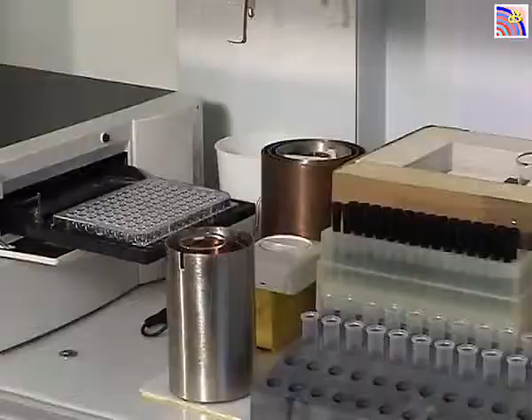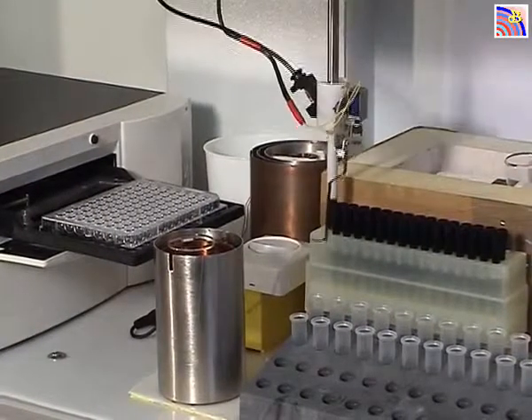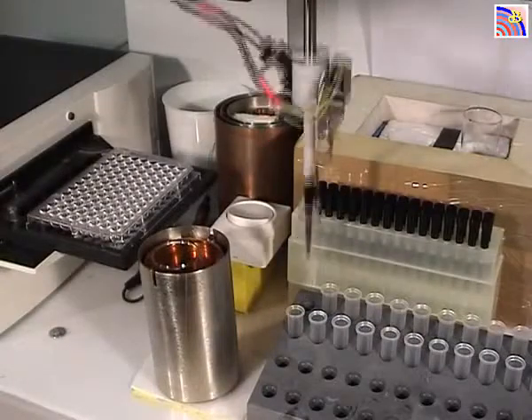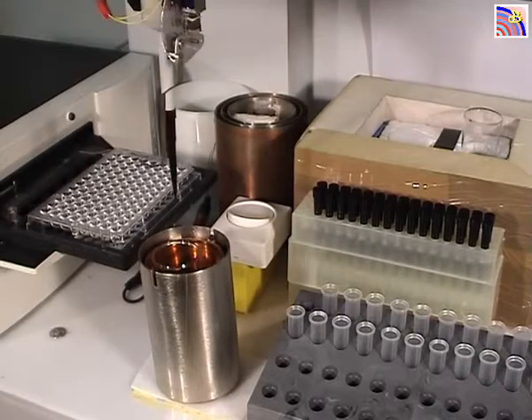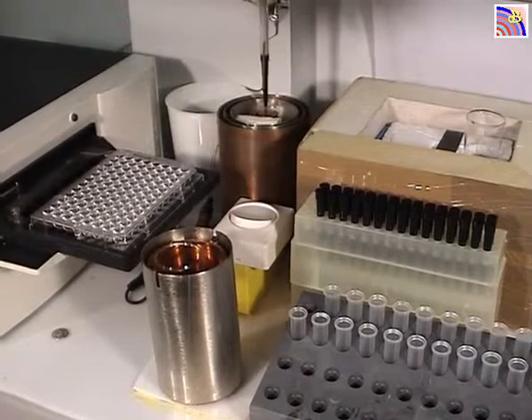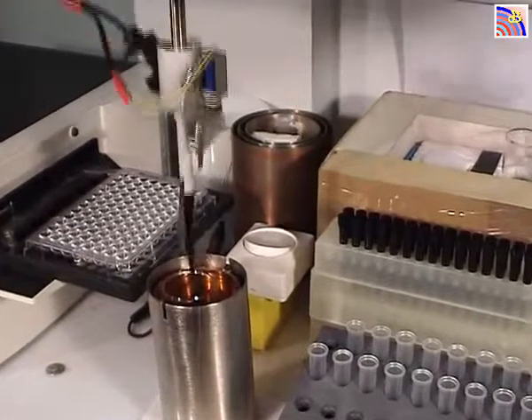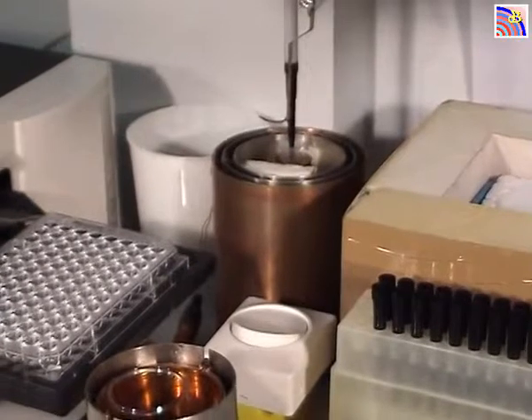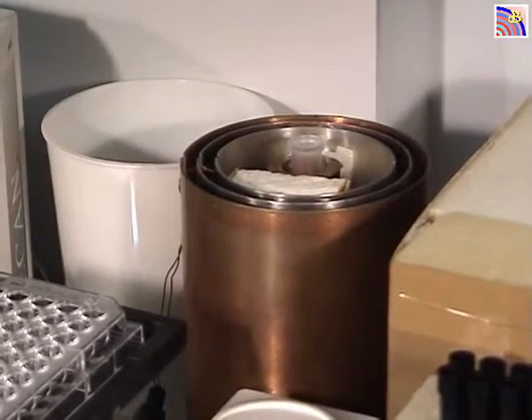Now the machine is working. It is picking up a tip, then it will take an empty tube and put it into the carrier. Then it will get water, add it to this tube, and then a second aliquot of water is added to the tube. During 5 minutes, this tube will be submitted to the signal.